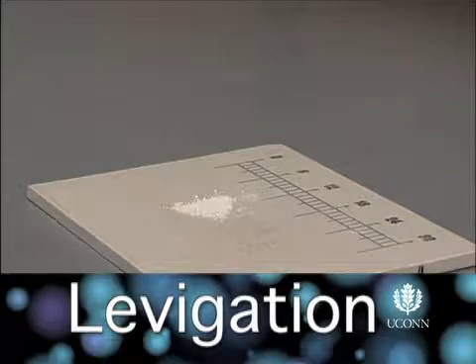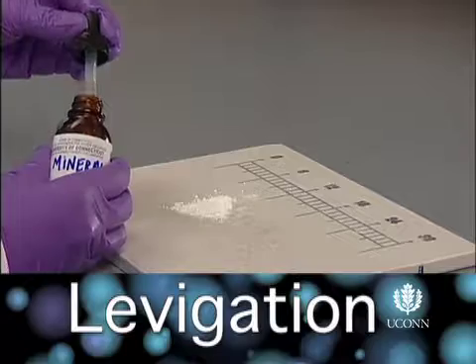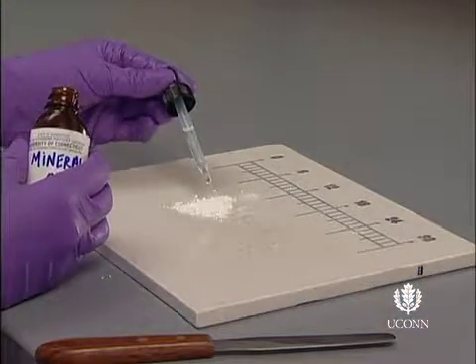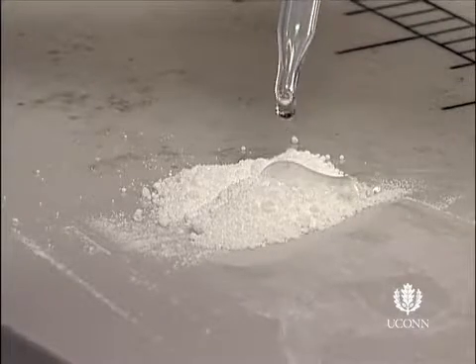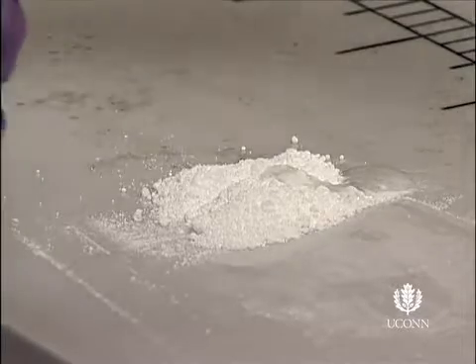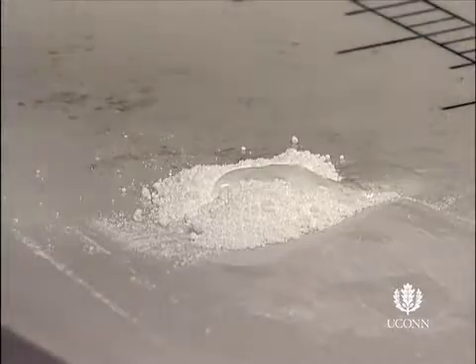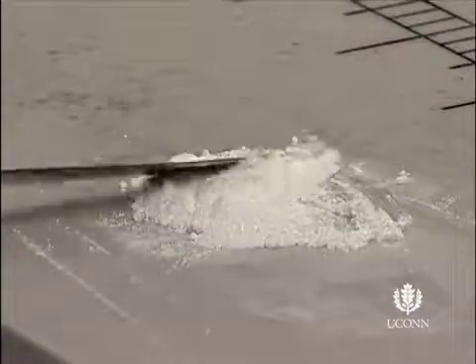Levigation is the process of reducing particle size of a powder and reducing agglomerates of particles for more even distribution. This is accomplished by levigating the solid with a small amount of liquid. The liquid that is used is referred to as a levigating agent. This liquid is typically somewhat viscous and has low surface tension to improve wetting of the solid. Choose a levigating agent that is miscible with the ointment base.